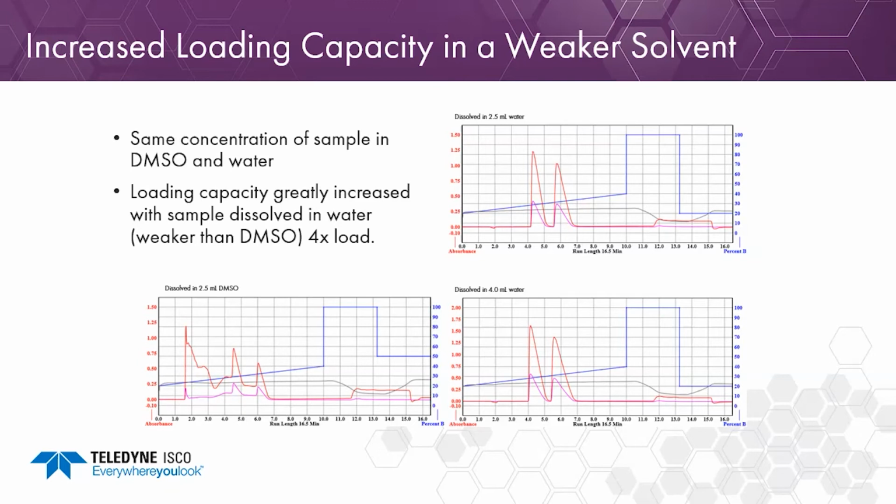Notice the shark fin on the prep HPLC, that's typical of overloading, and that's okay. We still get baseline resolution because we have good separation here.